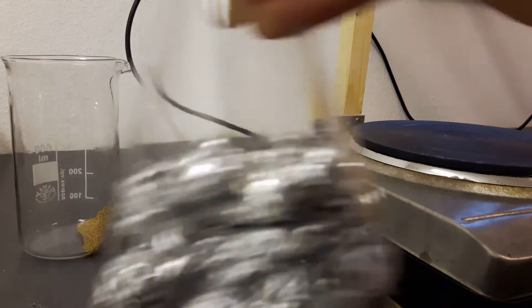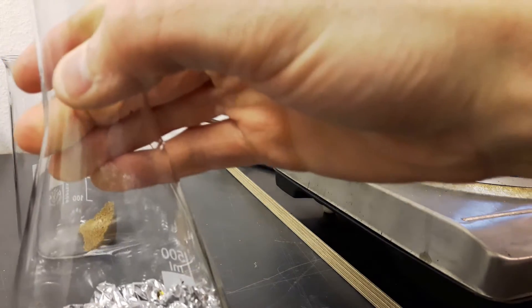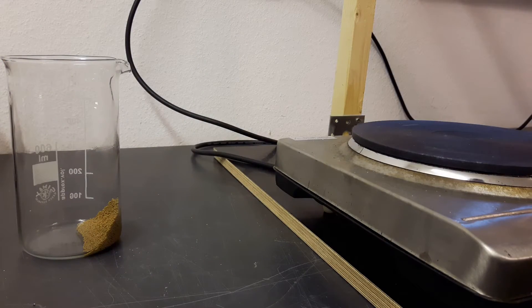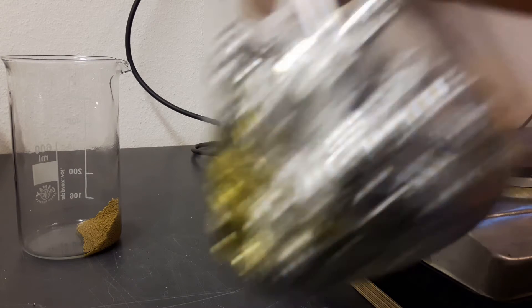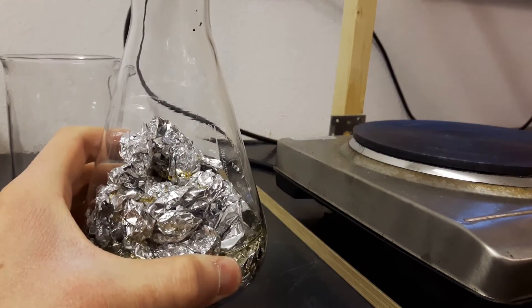It partially started to melt down so the plastic and rubber sealing started to melt down. Which was not very obvious but I already had it in mind that something like this could happen. And so I lost pretty much all of my isopropoxide which I reacted over the whole week. So this apparatus ran really for over 3 days and ended with a failure.